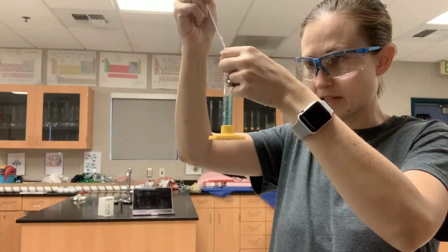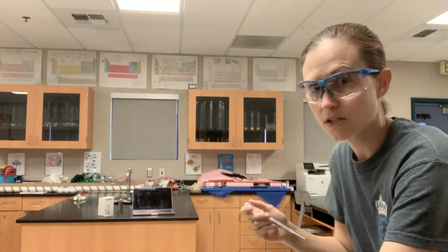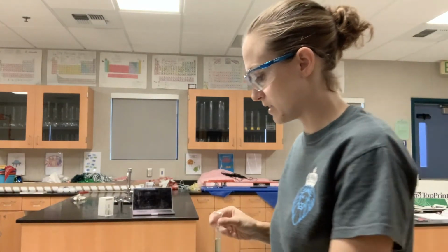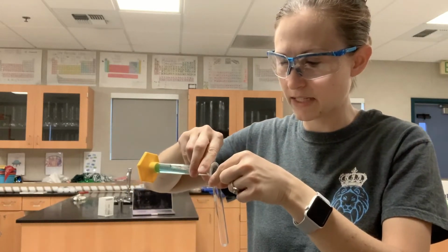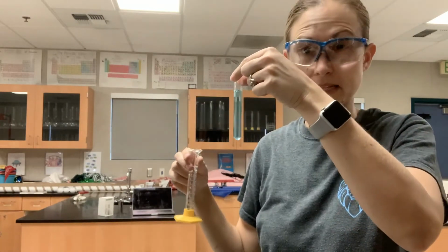And obviously I should be doing this flat on the table, and I'm going to check it in a sec flat on the table, but I just wanted you guys to be able to see. So I'm going to bend down. I've got 8 mLs exactly. Now I can pour that into another cuvette, making sure that I'm only touching the top of it, not the sides where the electromagnetic radiation is going to go through. Okay, so that's my next solution.